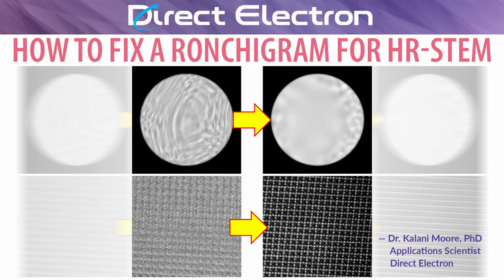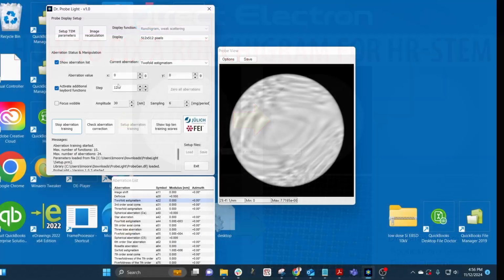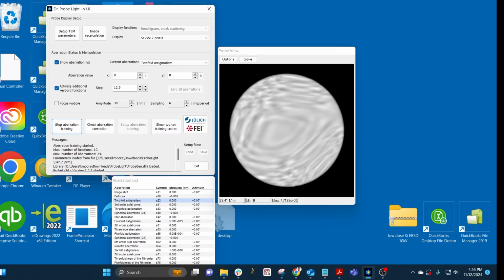I'm an application scientist with Direct Electron, and today I'm going to use this nice simulation software from Jülich to show you how to adjust your Ronchigram for really nice atomic resolution STEM imaging. We're going to adjust twofold astigmatism, which is labeled as A1 for the coarse, or condenser for the fine, and coma, which is labeled as B2 on your actual microscope controls.